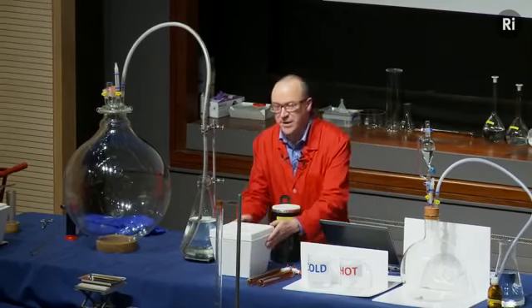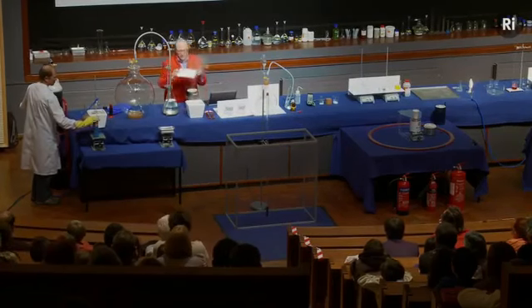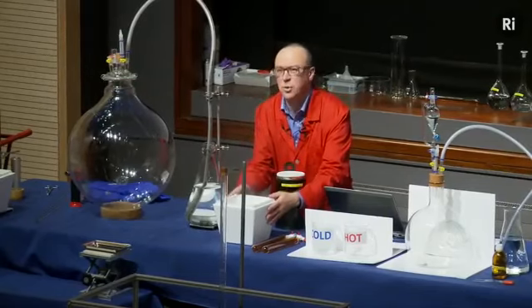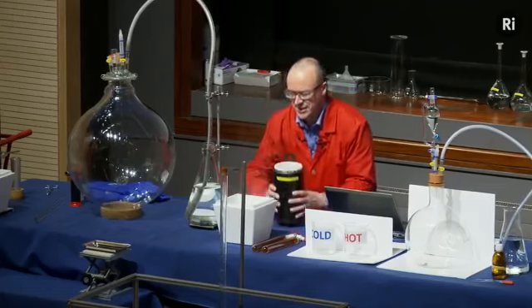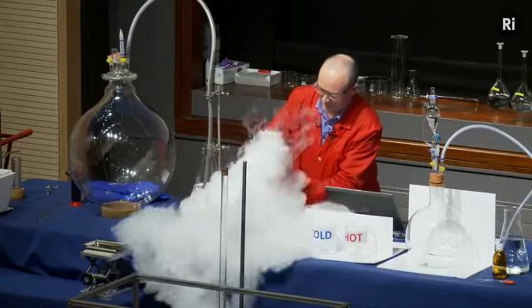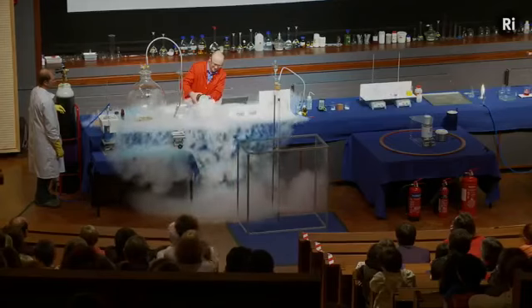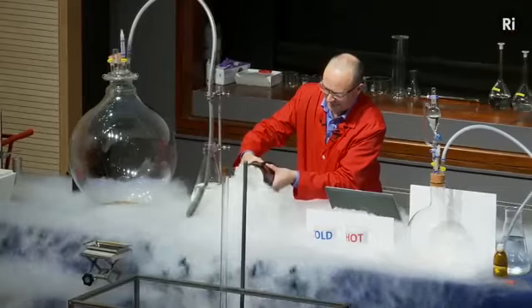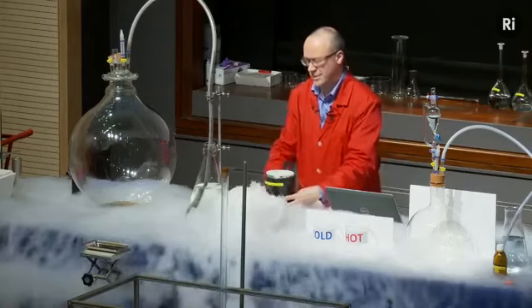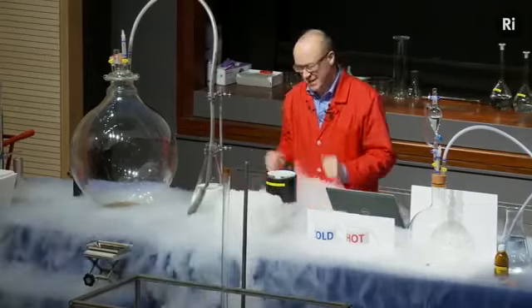So just for a little bit of fun, I thought we'd see what happens if we take some liquid nitrogen at minus 196 degrees centigrade and pour it into some pretty much boiling water. Okay, and this is what happens. There's no real point to that, it was just for fun, you understand.